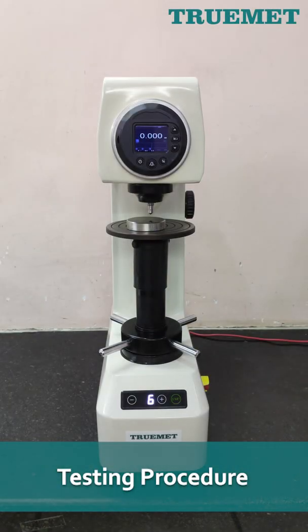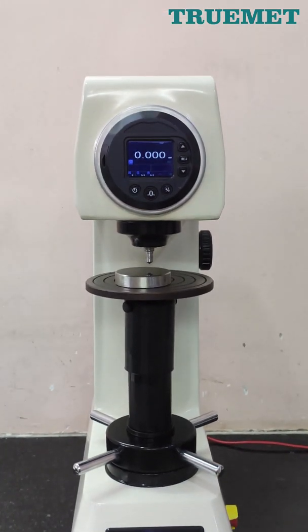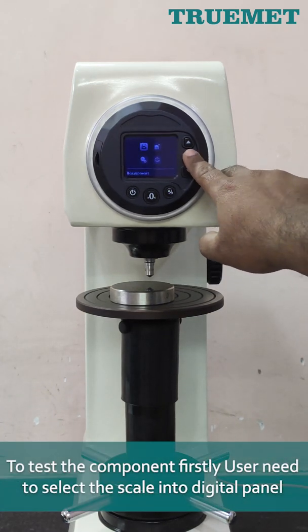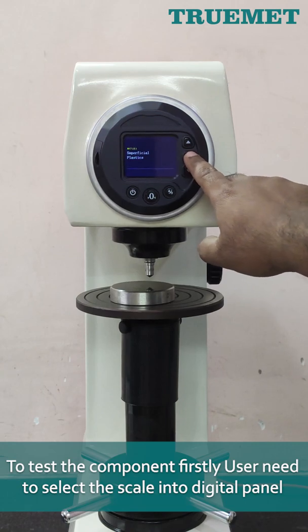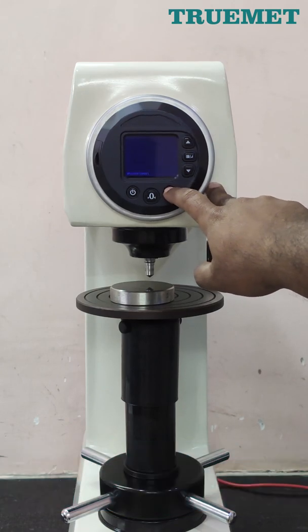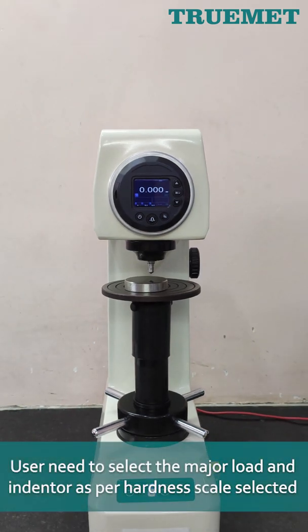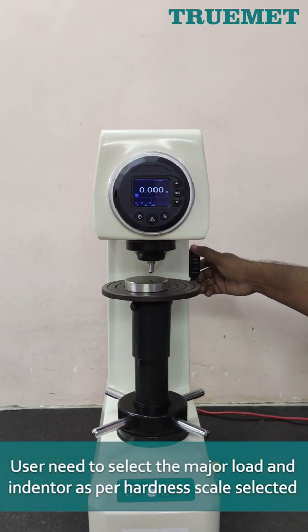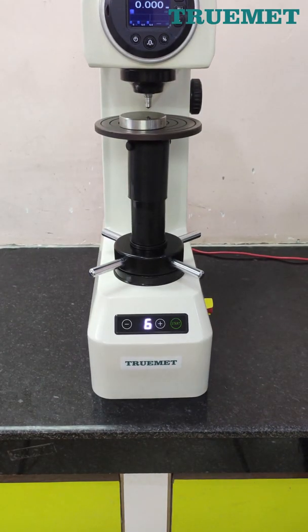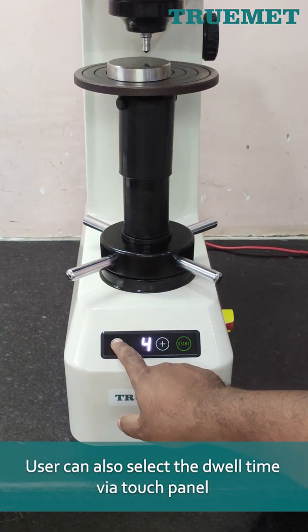Testing procedure: To test the component, firstly the user needs to select the scale in the digital panel. User needs to select the major load and indenter as per the hardness scale selected. User can also select the dwell time via the touch panel.